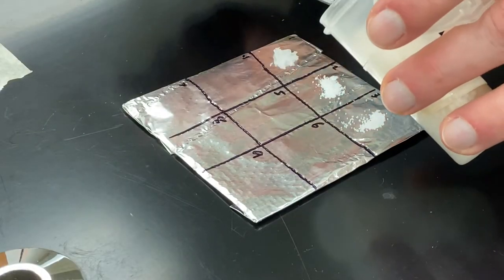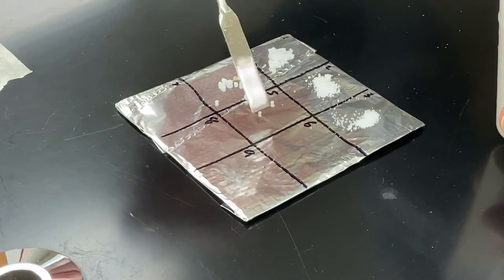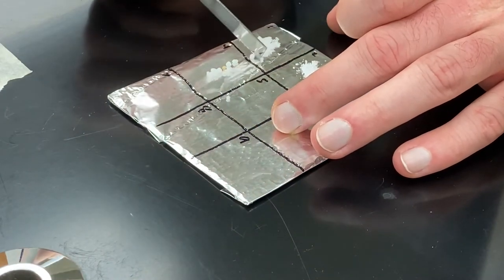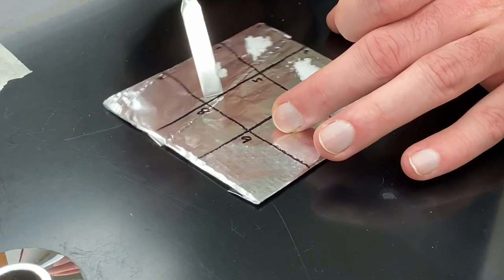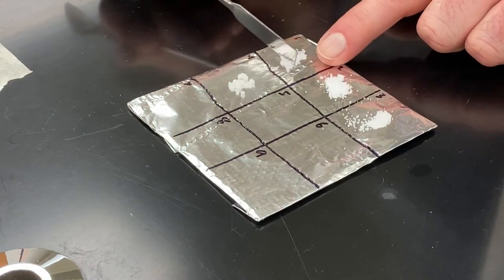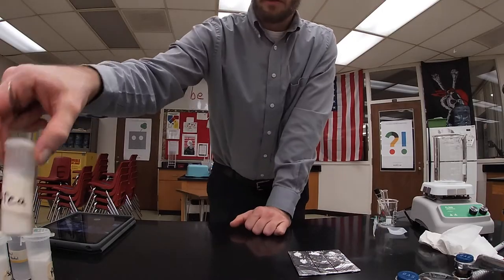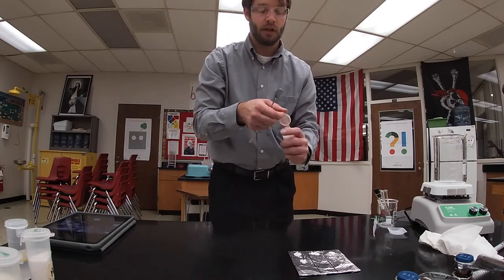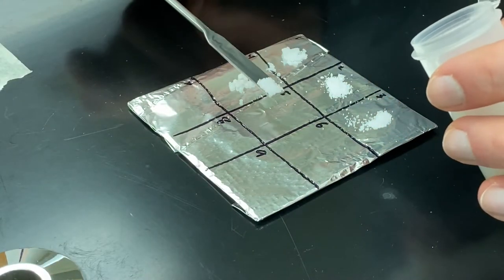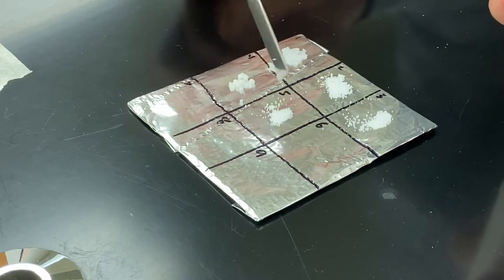Next I have urea. This one is in ball form so I have to be careful that these don't roll around. I might need to scoop them into a pile. The next one is table salt — sodium chloride. Table salt often has different components such as sodium iodide as well, but it's mainly sodium chloride.